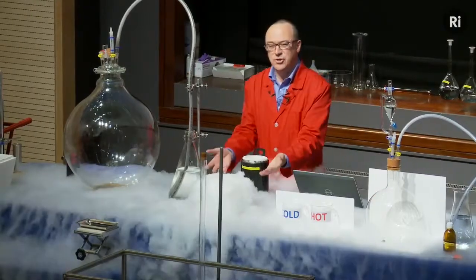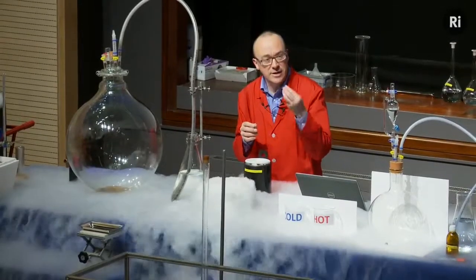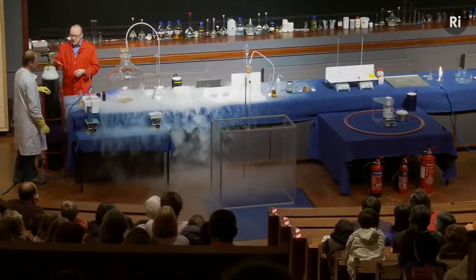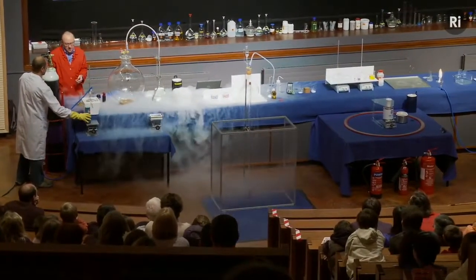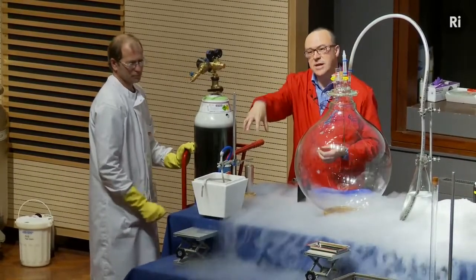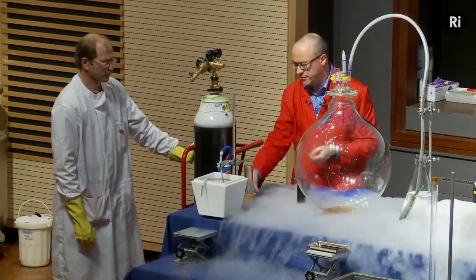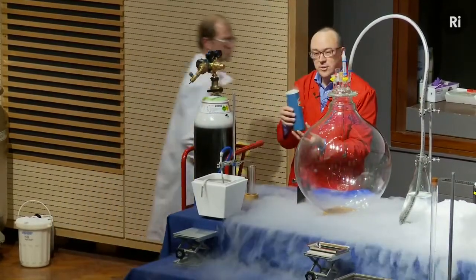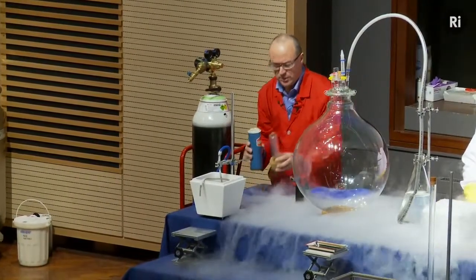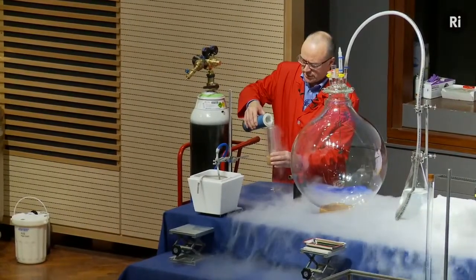Okay, so this liquid nitrogen is extremely cold, and we can use it to cool down oxygen gas so that it too becomes a liquid. And that's what Chris has been doing over here. So this cylinder contains oxygen gas, and Chris has been passing the oxygen gas through a coil of copper that sat inside some liquid nitrogen. And the oxygen has been turning into a liquid itself. And so this vacuum flask contains liquid oxygen. And I just want to show you one interesting thing about liquid oxygen. I'm going to pour it into this test tube.